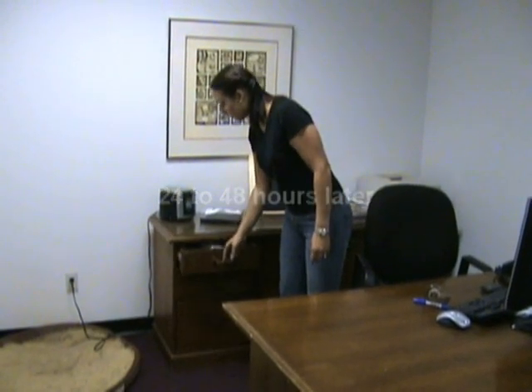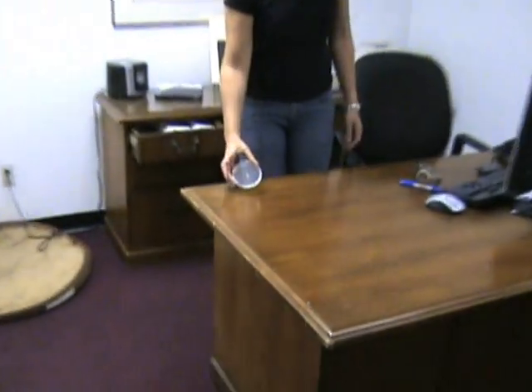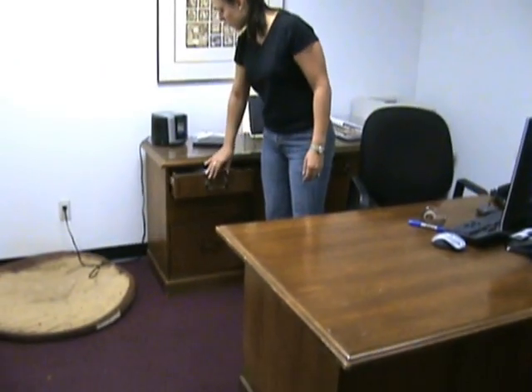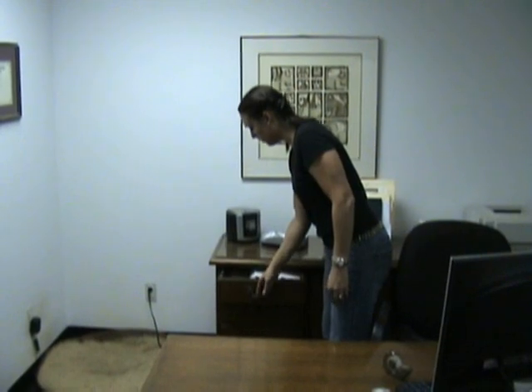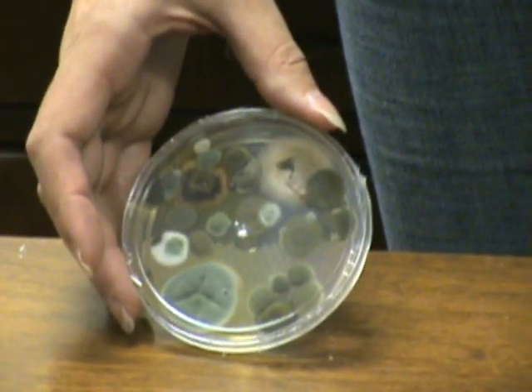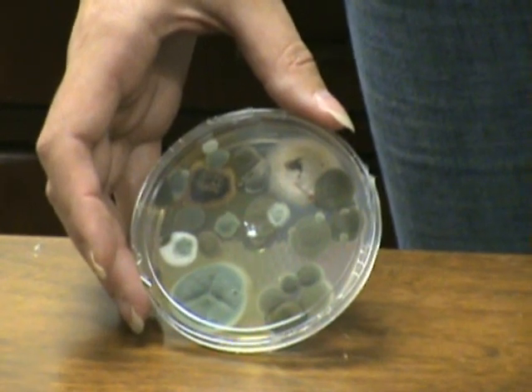After 1 to 2 days, examine the kit. If nothing appears after this time, place the kit back in its dark and dry location and continue to incubate for 5 more days. Keep checking the kit over the next 5 days. If you see growth, send the test kit to IMS Laboratory along with your information form and payment for analysis. If there is no growth, simply throw the kit away.